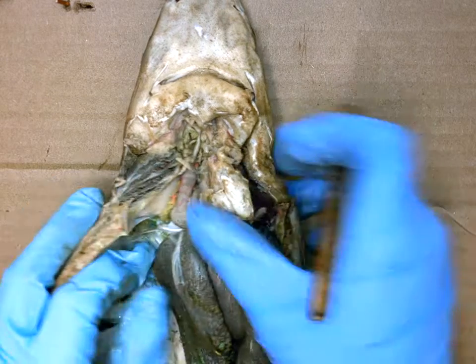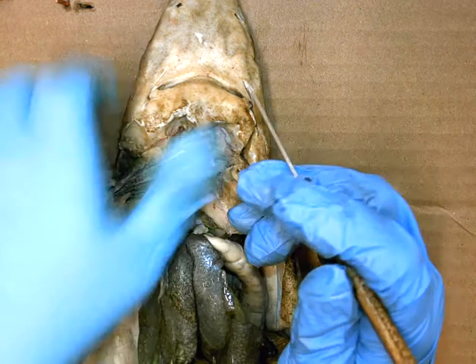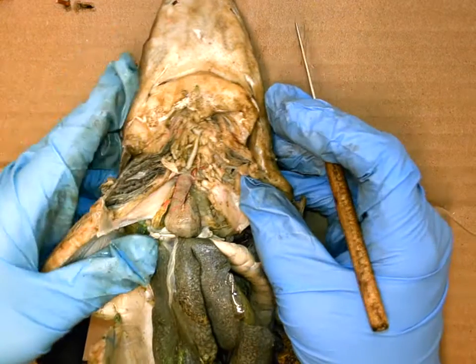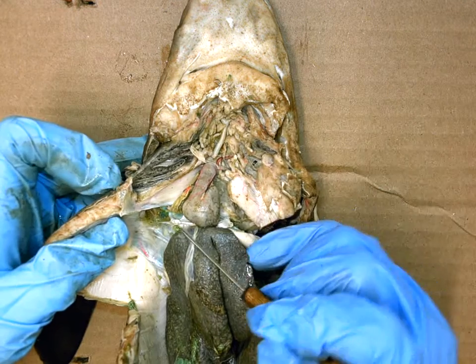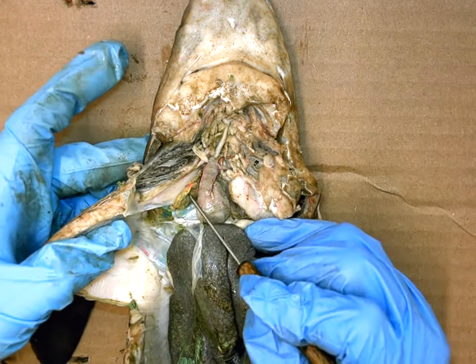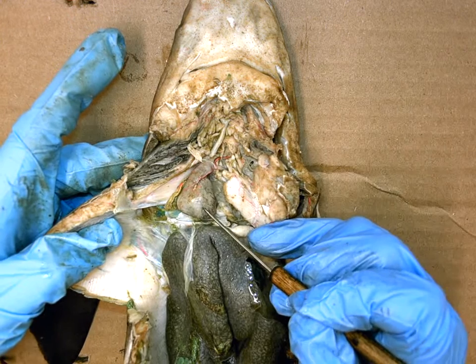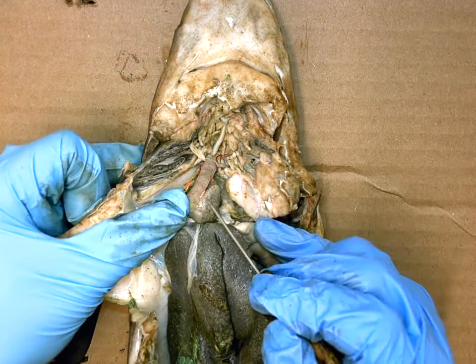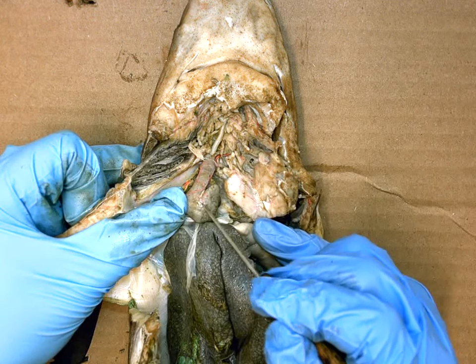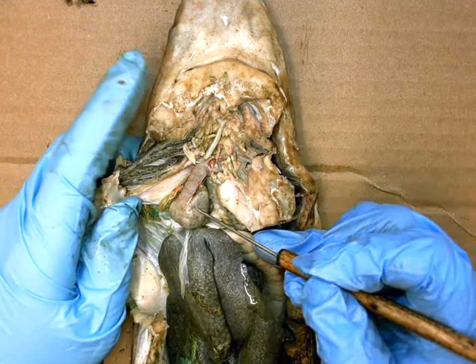We're going to be looking at the shark's circulatory system today, starting at the heart and covering the arteries. The first area in the heart is the atrium, which is a deflated chamber in the back. The atrium pumps blood into the large muscular chamber, which is the ventricle. There are also tiny arteries on the heart itself called the coronary arteries, which feed the heart.